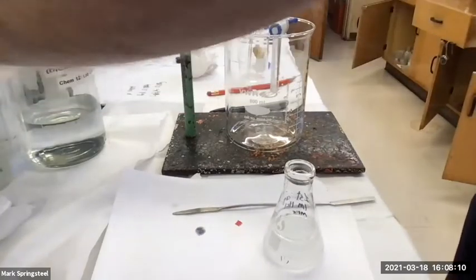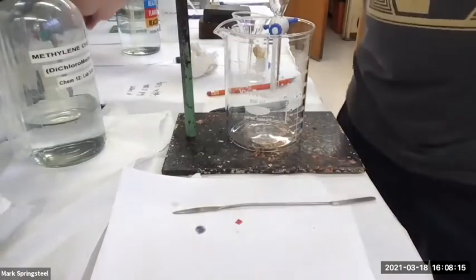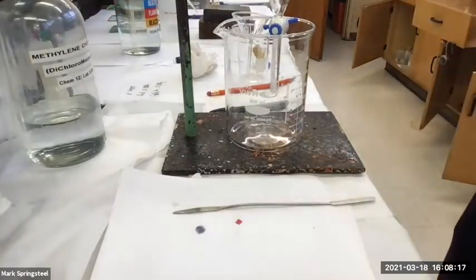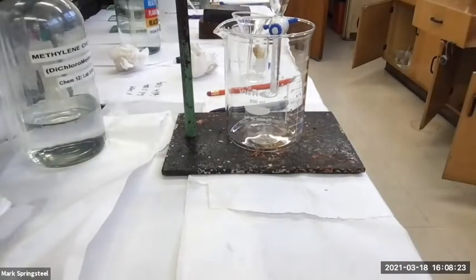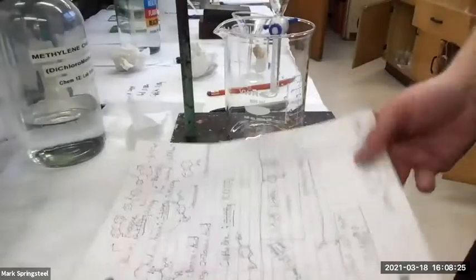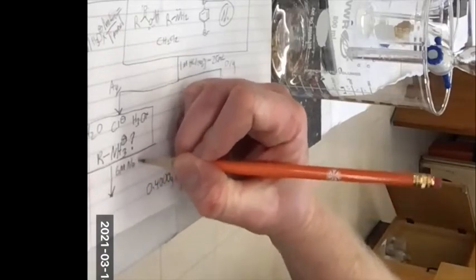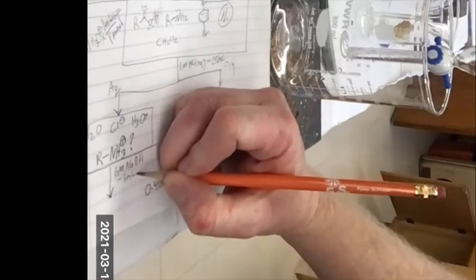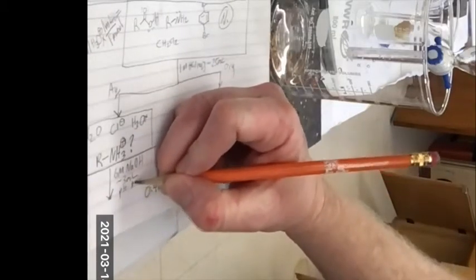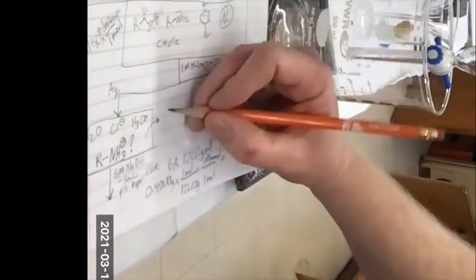Here we go. Okay, so I'm going to set this aside. I'm not going to get rid of it. I'm going to keep it for now. It's labeled. I know what it is, but I'm going to now proceed as if I don't have the amine. So let's write down what just happened. I added 6 molar NaOH, about 3 milliliters, and the pH paper was blue. This pH paper was pink, huh?